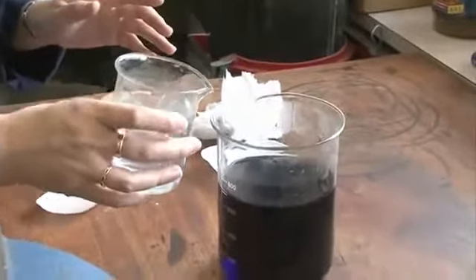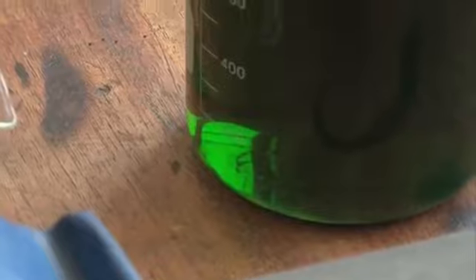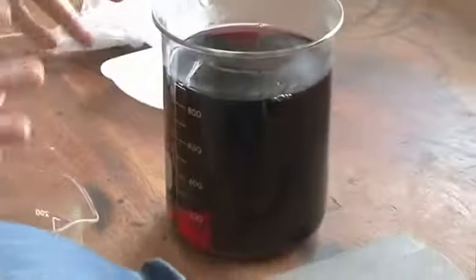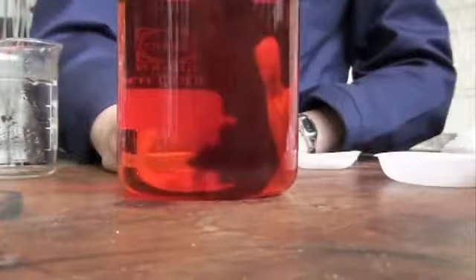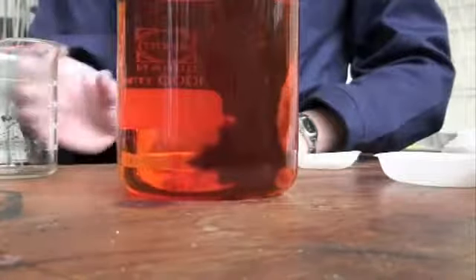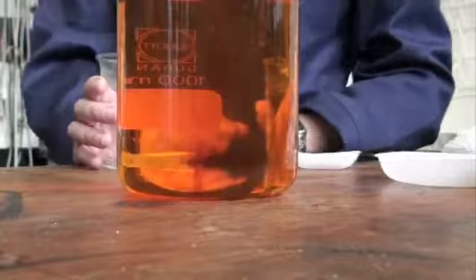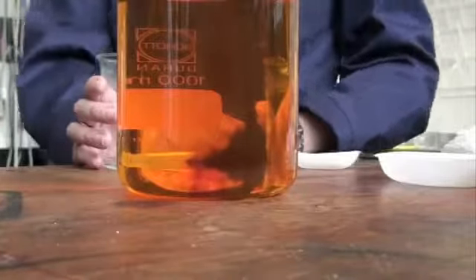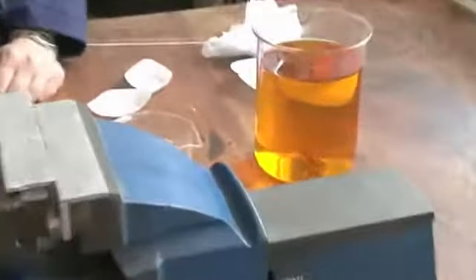So first of all it starts out blue, we pour this in and it instantly goes green. So we've got a nice green colour which won't stick around for long. Once it goes green, it's happy like that, but then it enters a transitional state of red. So you've got this red colour here, and then finally it goes to a nice orange. Then following that will be an amber. And we'll leave it to go to completion, and its final colour change will be to yellow.